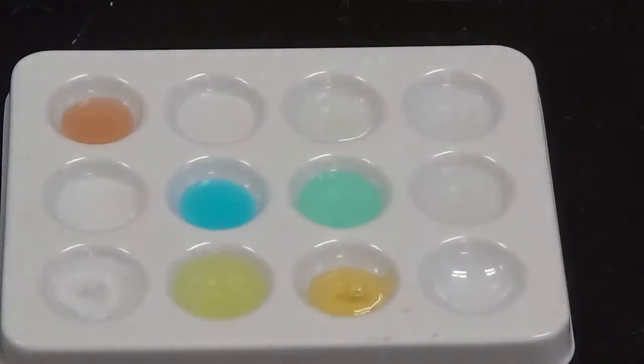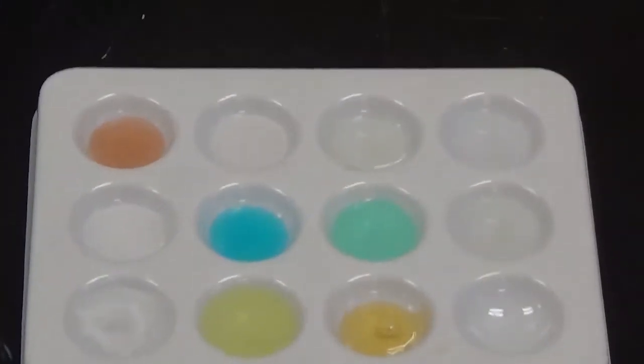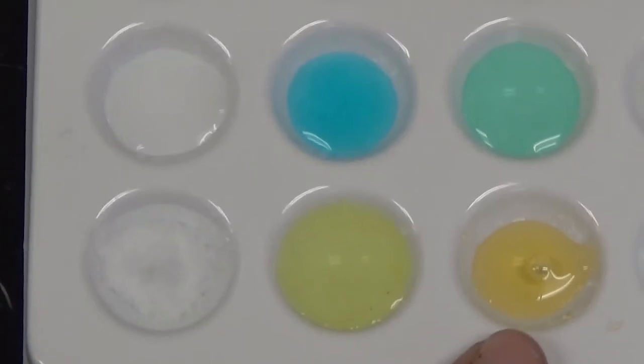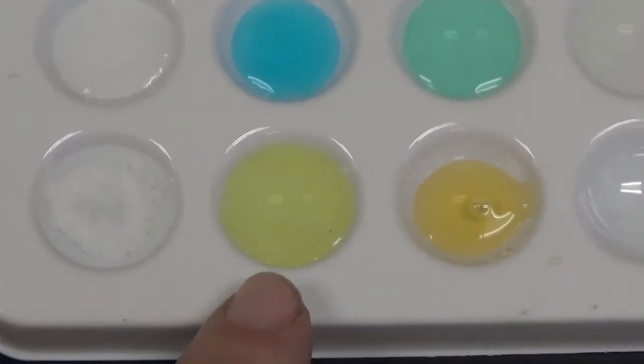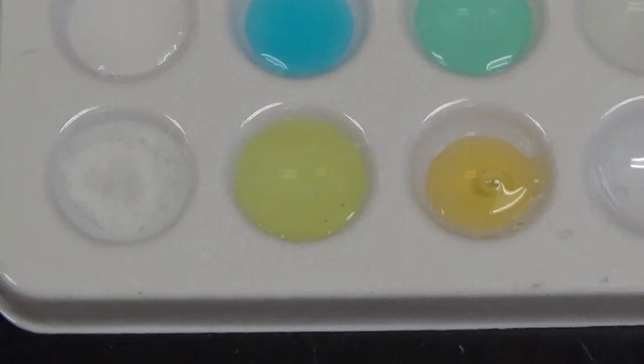And I'm putting it over there in the well beside it so you can see that there was a chemical reaction, because it's kind of hard to tell on that one. If you look, this was the color of the iron nitrate all by itself, and here it got more yellow. It lost its gold color. That is not a simple dilution. That is a color change, so you have evidence of a chemical reaction.